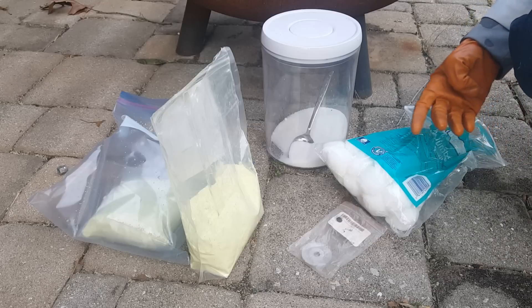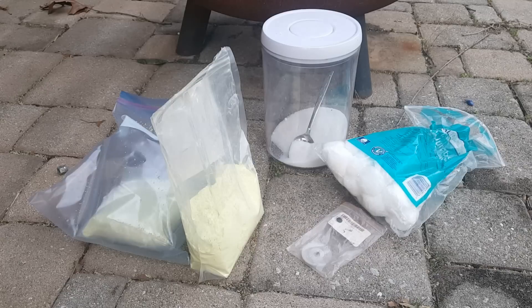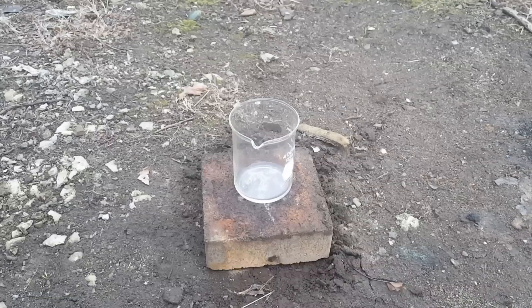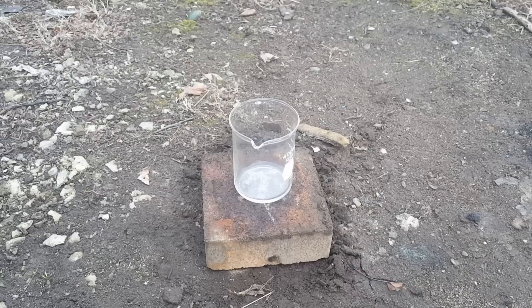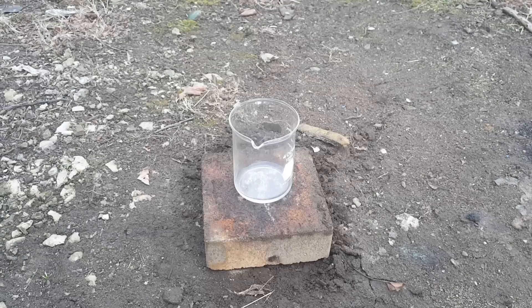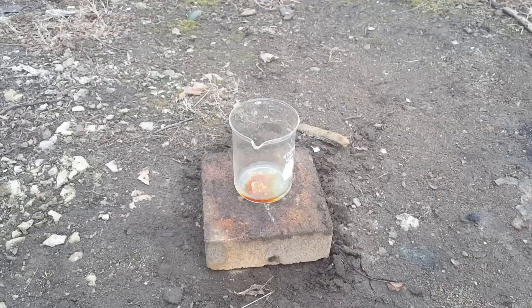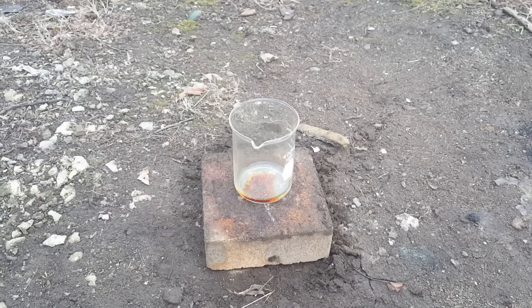Upon testing the chloric acid on cotton, the solution of acids reduced the cotton to carbon, water, and carbon dioxide in several seconds. I expect these reactions to be pretty violent and splatter solution around, so I'm going to put my respirator and face shield on. Now I'm going to start making the acid — I'll add potassium chlorate slowly, little by little. If you add it slowly, it's much less likely that the chlorine dioxide will build up and explosively decompose. The yellow-green fumes you see are a mixture of chlorine and chlorine dioxide, as well as colorless oxygen.